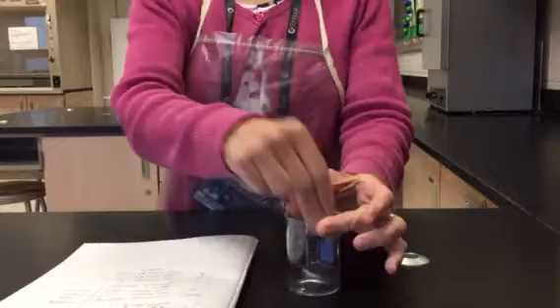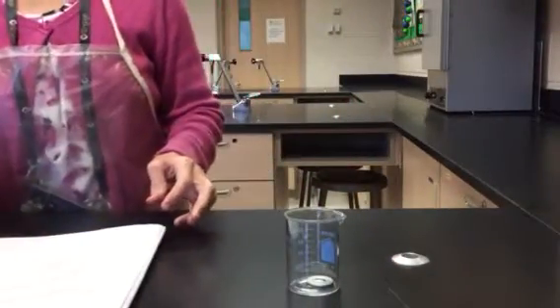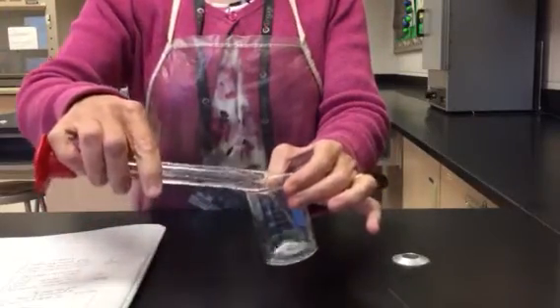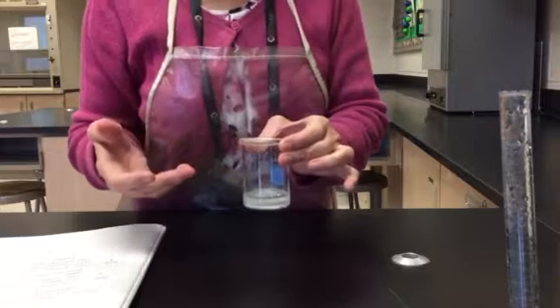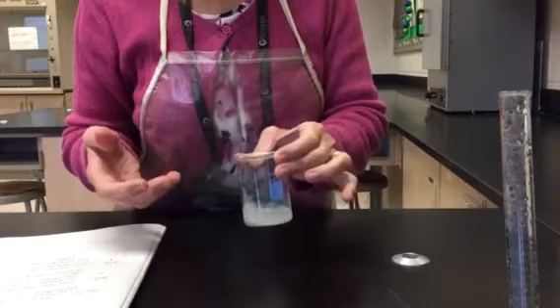All right, now I'm ready to take my washer. I'm going to put it in a beaker and add some hydrochloric acid to it. I've already measured it out. It does not need to be exact, so I'm going to go ahead and add my hydrochloric acid to this. What do I observe? I observe immediately that it is bubbling, which I expect because we're generating some hydrogen gas in this process.